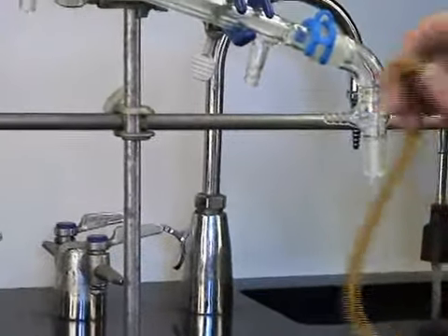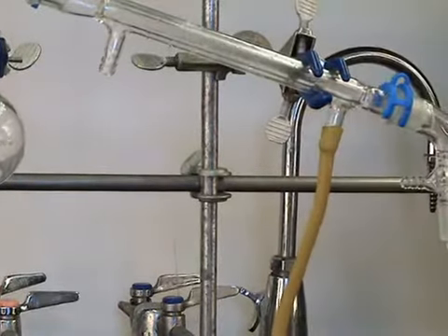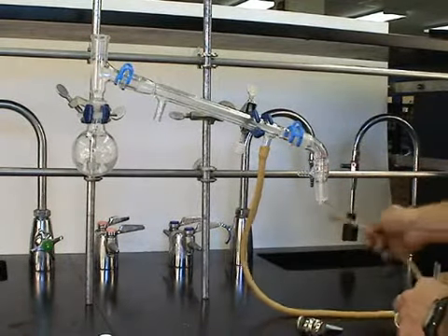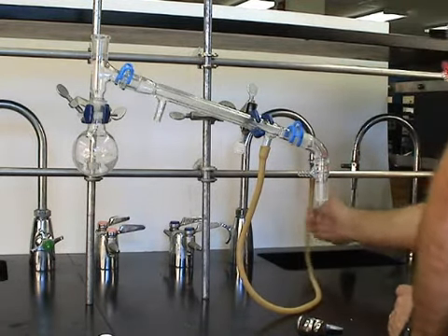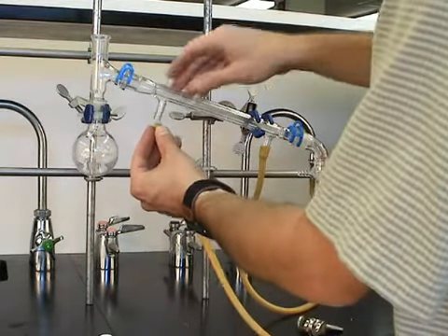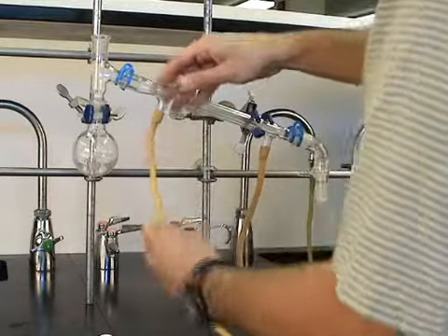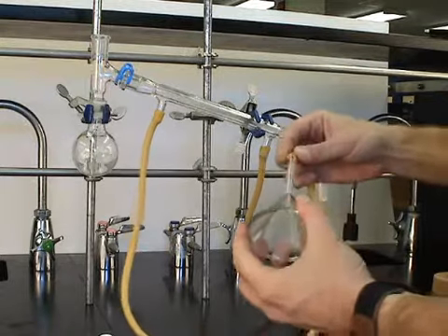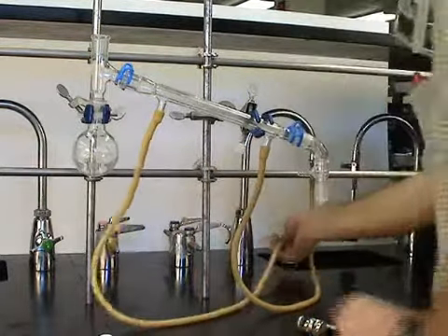Take a piece of latex tubing and wet it with a little bit of water and slide it up over the tubulature. The lower end of the condenser gets attached to the cold water tap. A second piece of latex tubing is attached to the higher end of the condenser. And this is going to be the drain. In order to keep the hose down in the sink, we attach it to a glass stem funnel. This simply serves as a weight so that the hose doesn't accidentally come out of the sink.